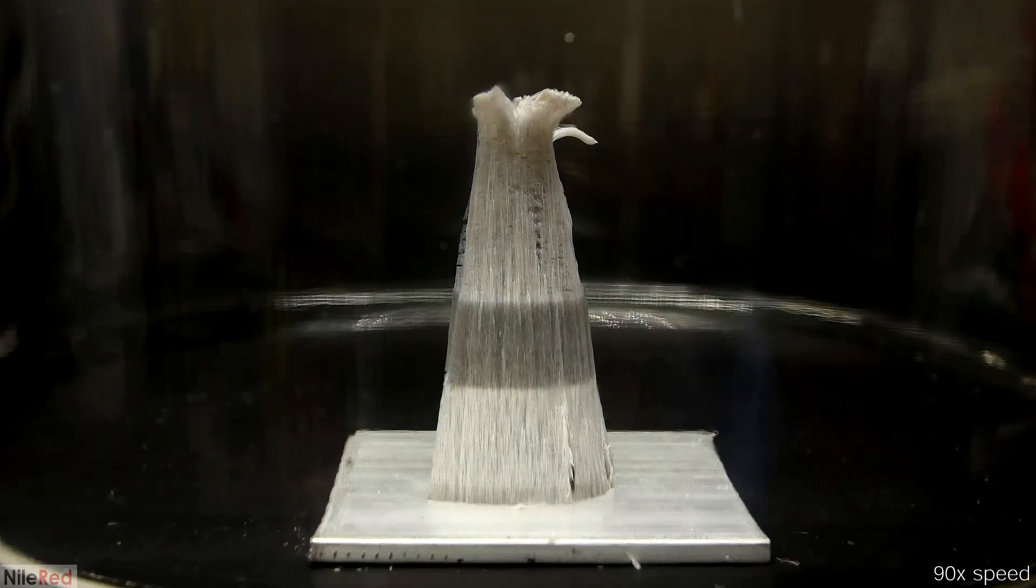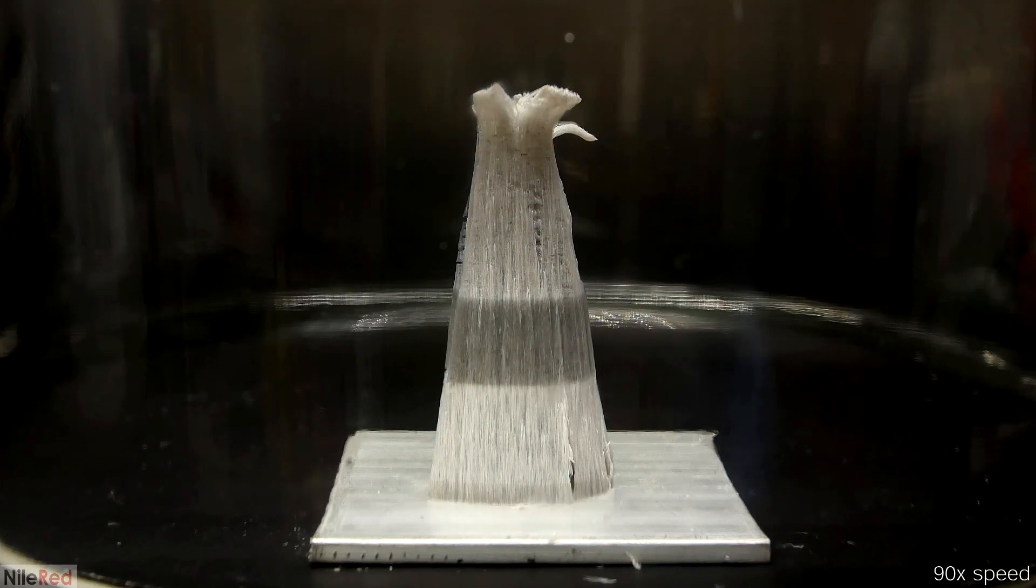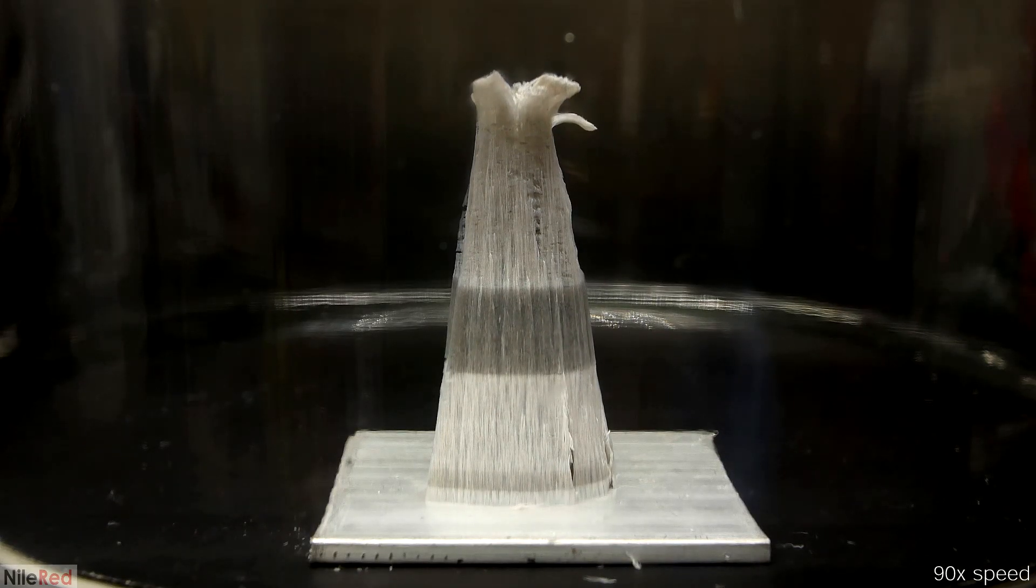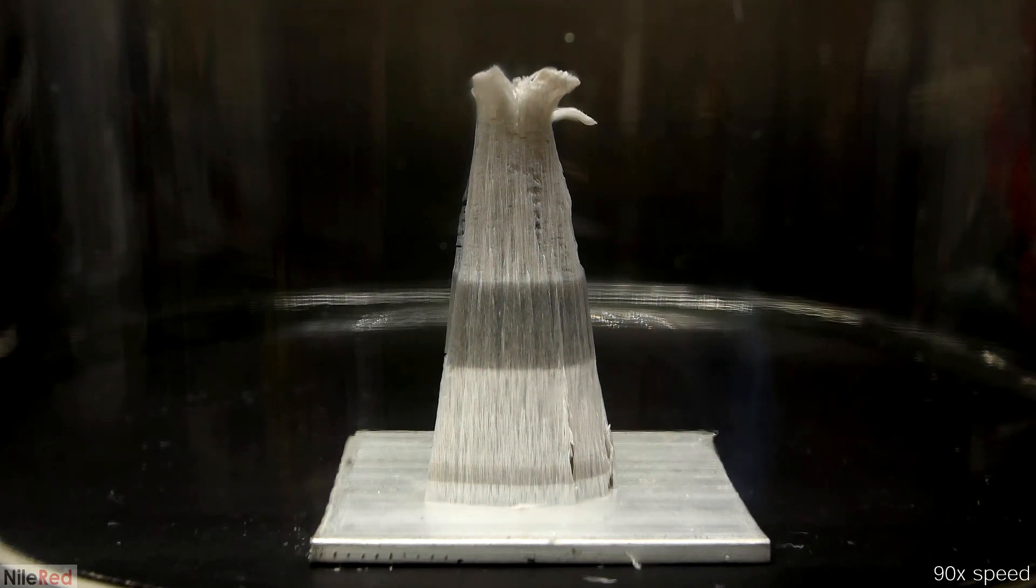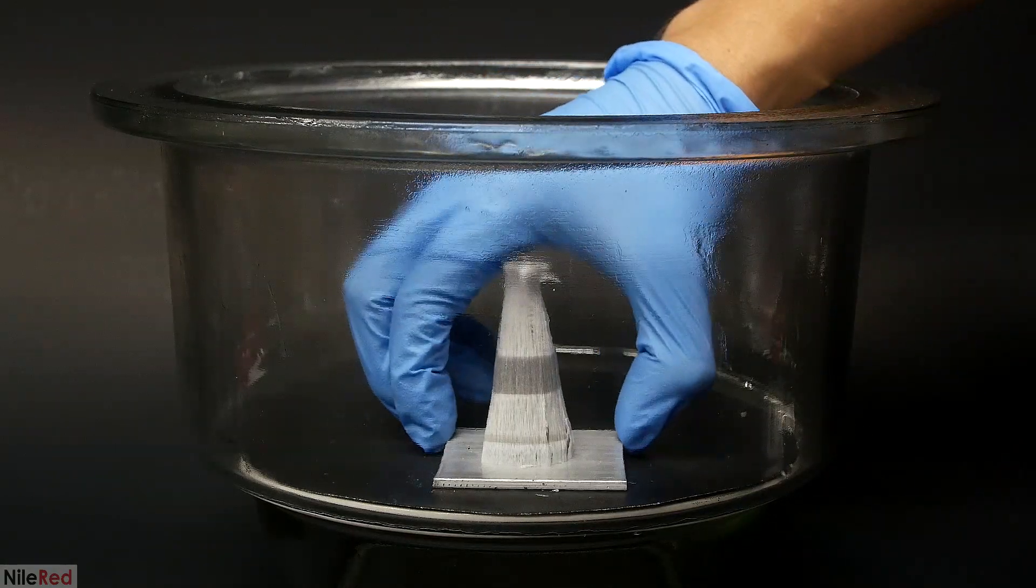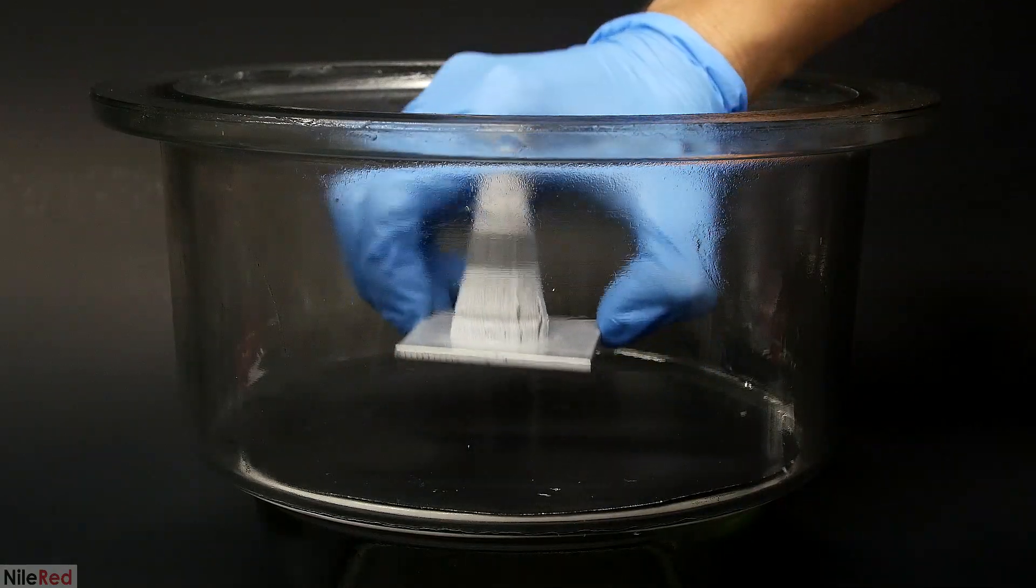Anyway, at this point I'm done playing around with it, so I take the top off the chamber and I let air get in, and just like in the other run it very quickly starts growing again. Now I want to take a closer look at it, so I very carefully take it out.